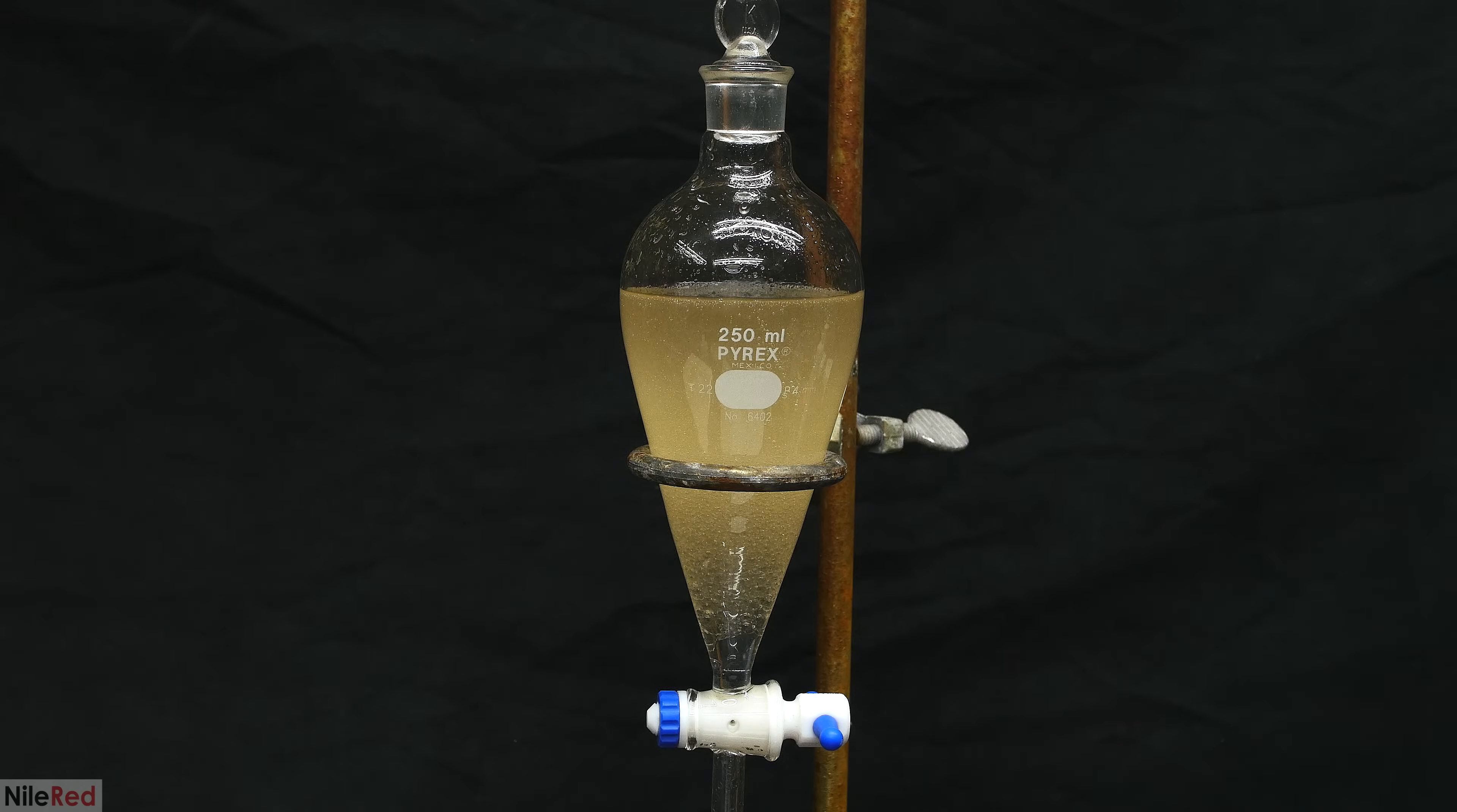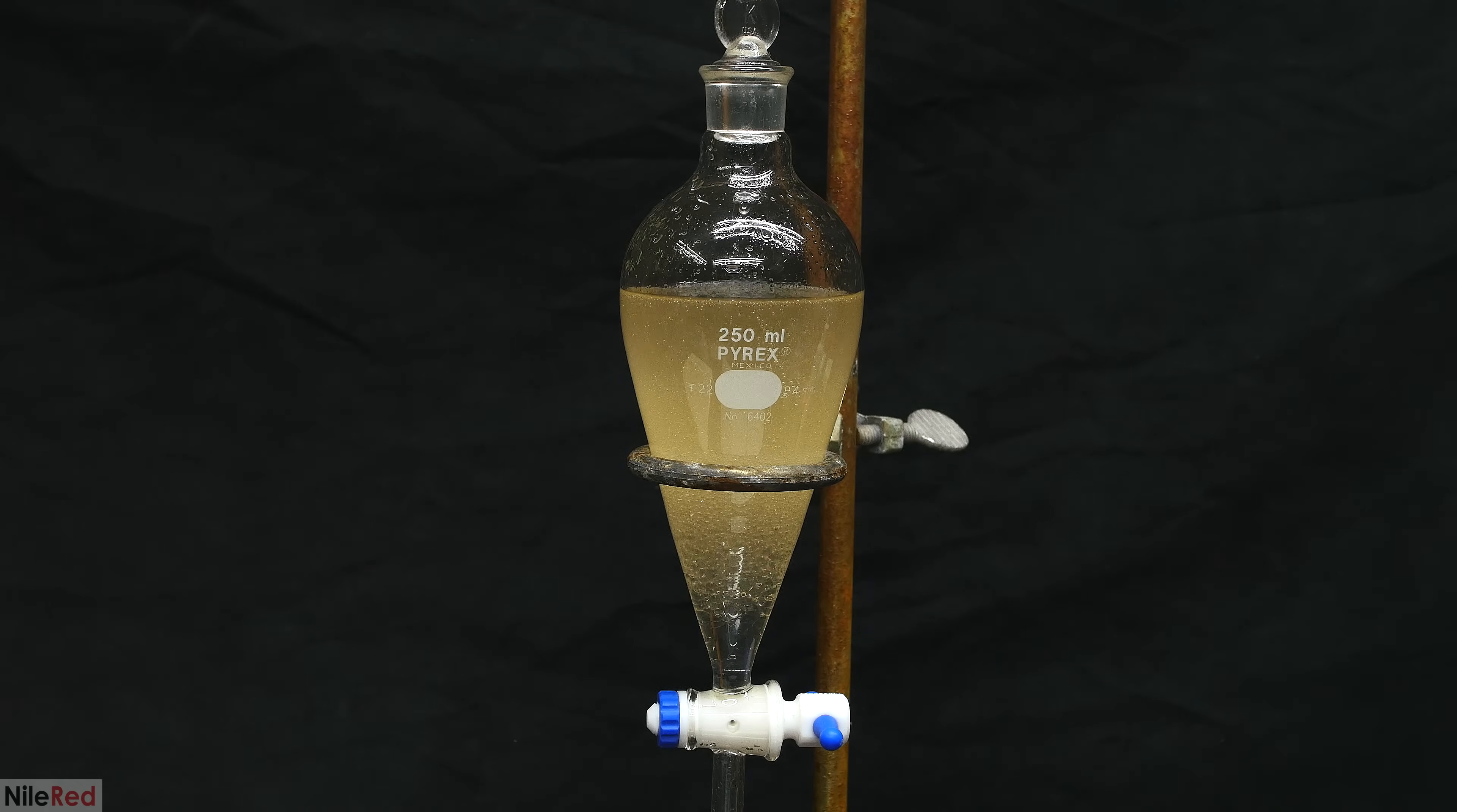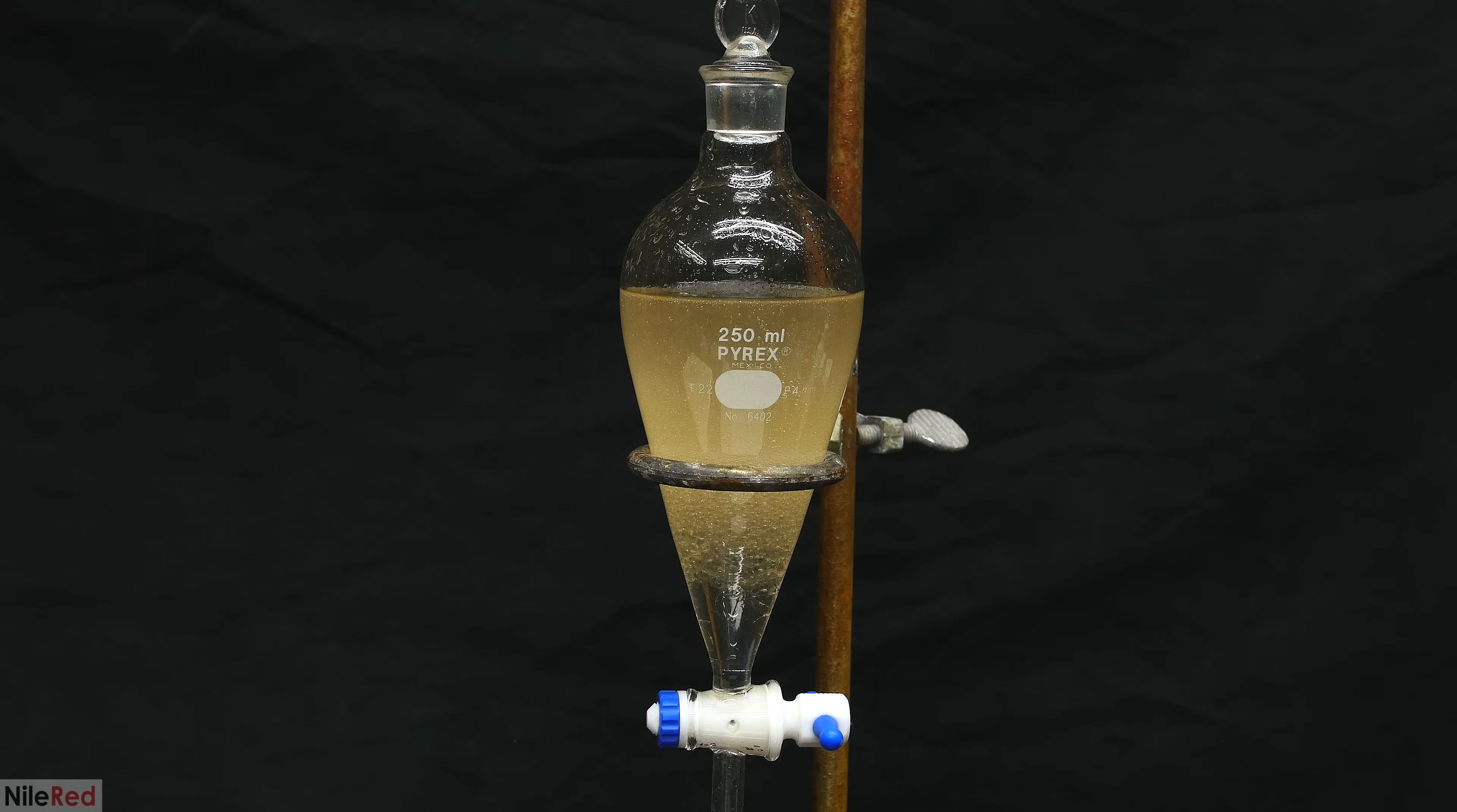As usual with a separatory funnel, we cap, shake, and vent it to get a thorough mixing, and we place it back on the stand for the layers to separate.